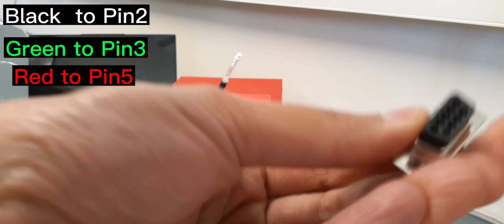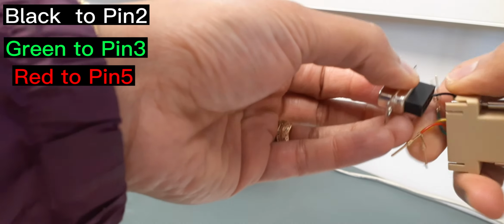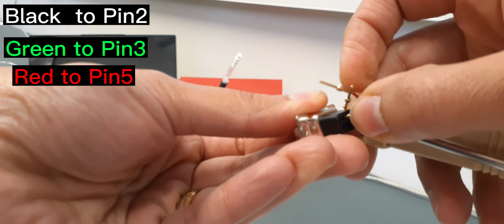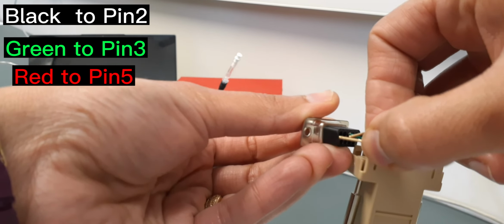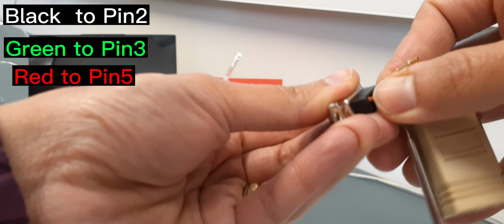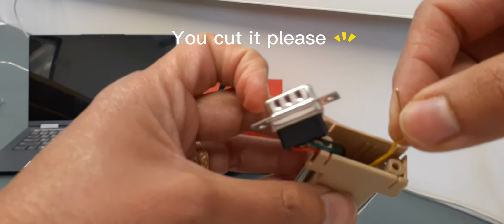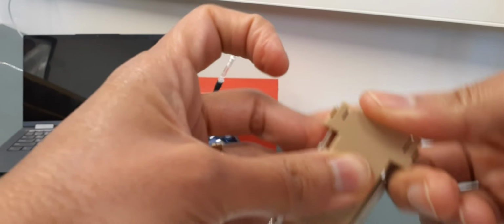Just see the 2. So this is 2, front row, and then the green to the 3, and the red one to 5. So that would be the last one. Also, they mentioned to cut out this yellow one as much as you can, but I just left that inside. If you press it into that, it will sit inside it. So now this part is ready.